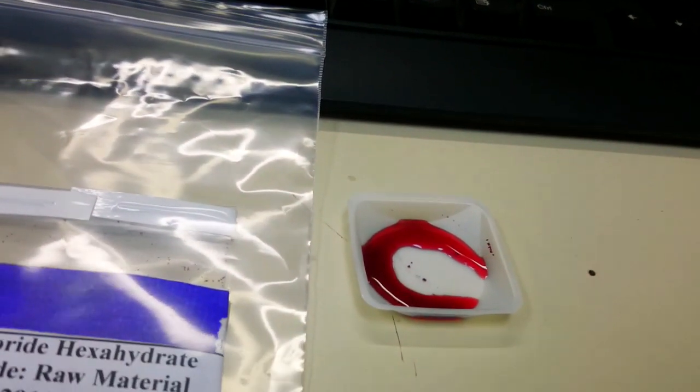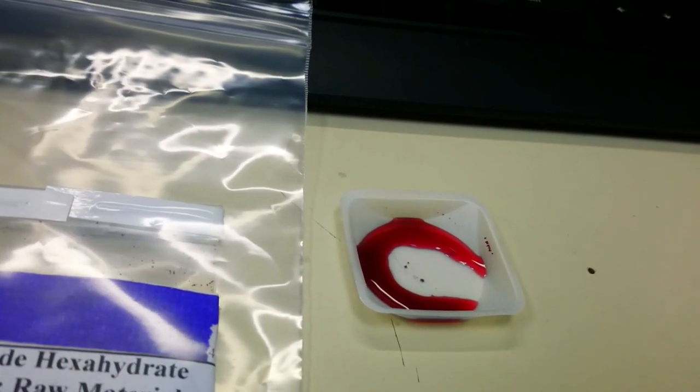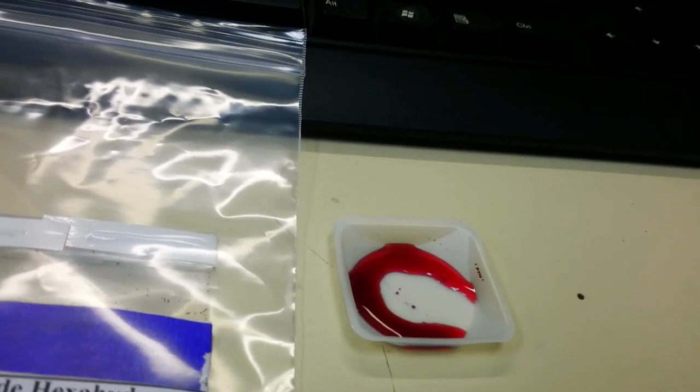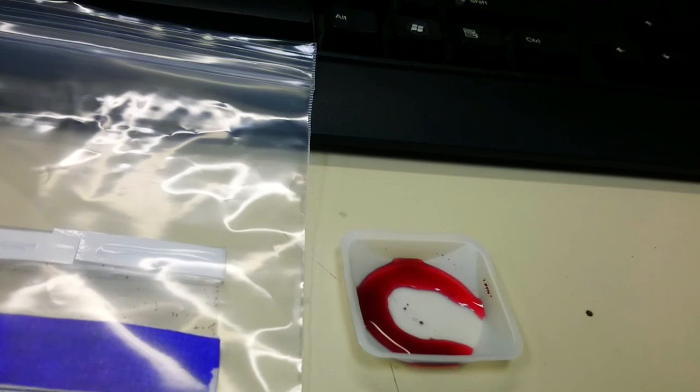It says that cobalt chloride is also used in organic synthesis and electroplating objects with cobalt metal.